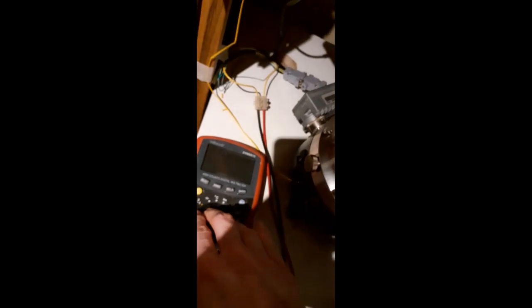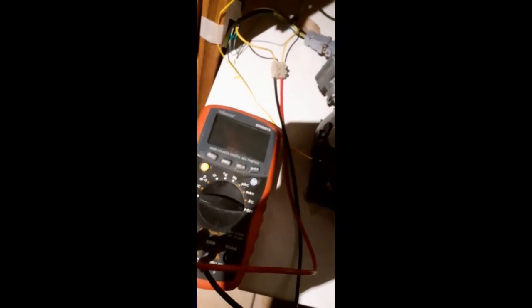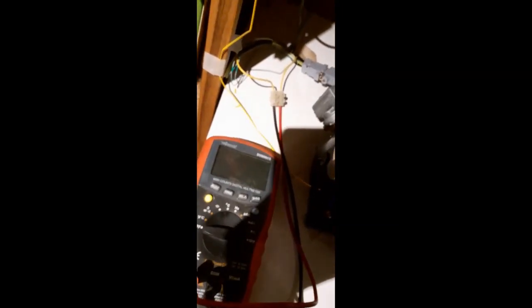I've cut open the 80 volt supply to the controller here, the pump. Monitor the power that the turbo draws, because that's pretty indicative of how the turbo behaves and the bearing quality. If the bearing is bad, it'll need all of its juice to run the pump at full speed, and sometimes it might not even get to full speed. But if it tapers off and doesn't really draw any power at all, that usually means the pump is good.